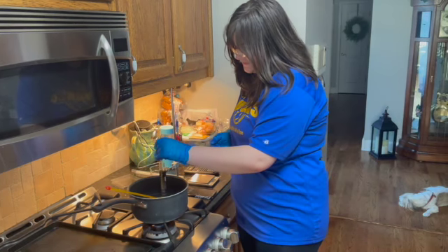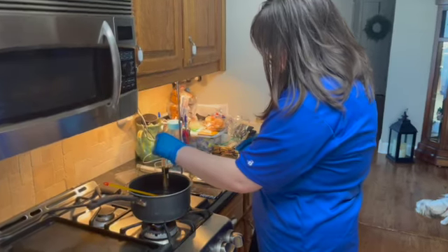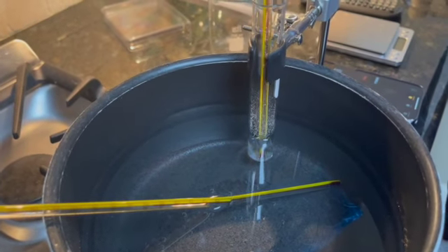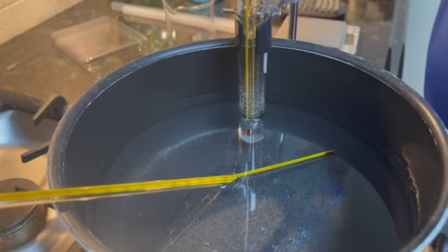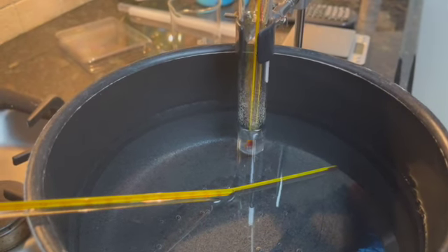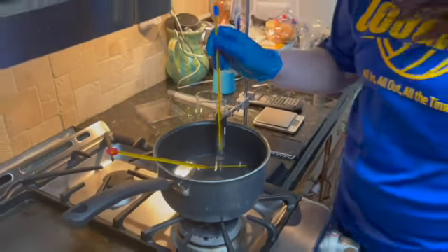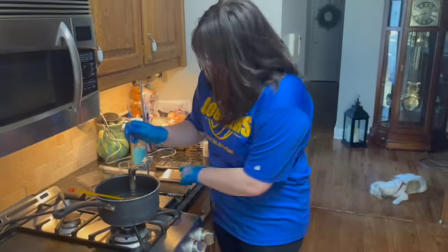So yeah, there's still just a little bit left in there, just a tiny little layer at the bottom that shows how much is left. And agitating it just a little bit to make sure that that is not just bubbles or anything, it is still some of the solid para-dichlorobenzene. So we've got to wait just a little bit more.